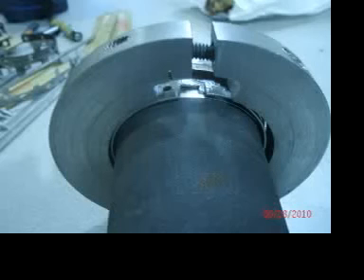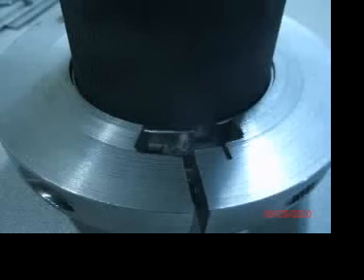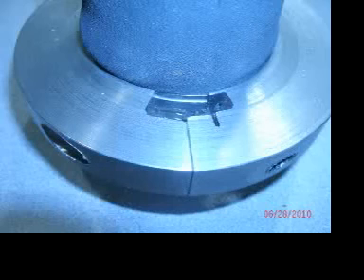You can see that you can start tightening it once you actually have it in there, and the ends of the fixture will come closer and closer together. The idea is to actually get the ends of the clamp into a position through working through the small hole in the fixture so that you can actually manipulate them carefully with a small screwdriver or something and get them into the right place, as you can see from these pictures.